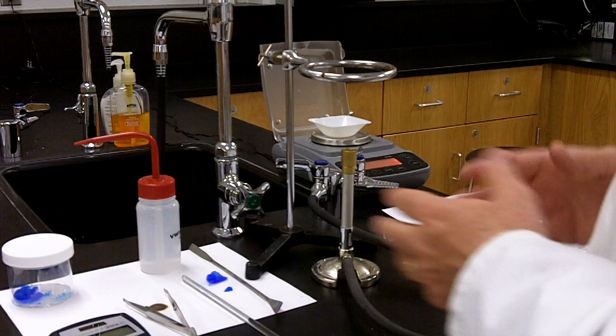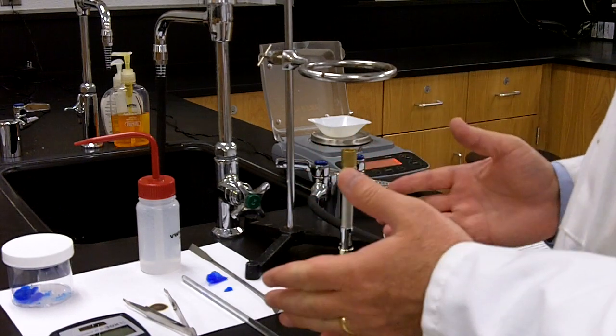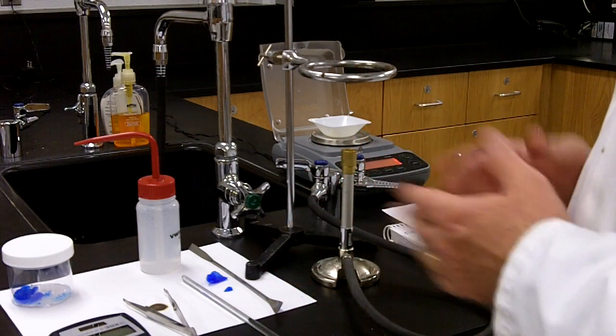All right, let's go ahead and get started. We're in the laboratory today. We're going to be doing a laboratory called the percentage of water in a hydrate.